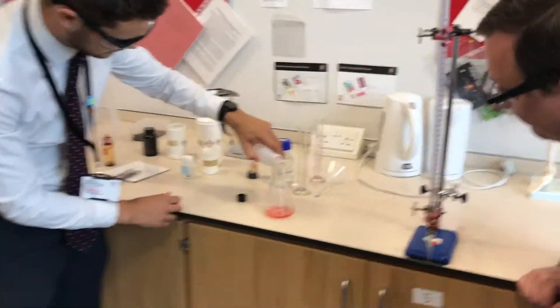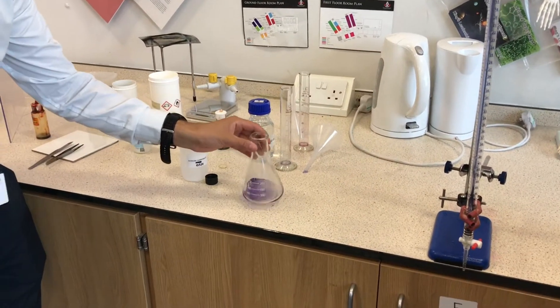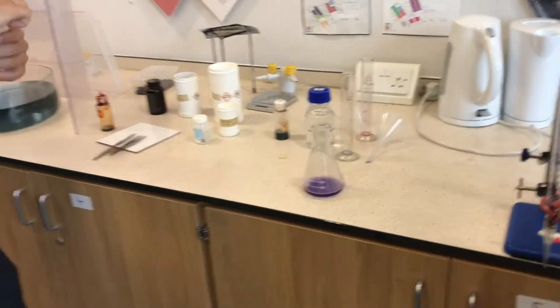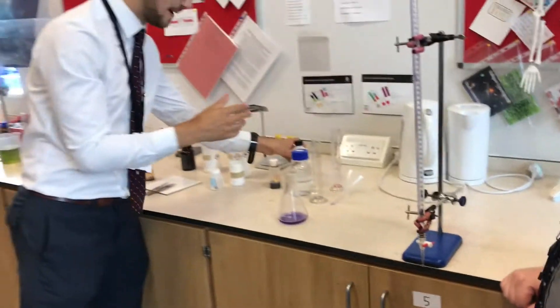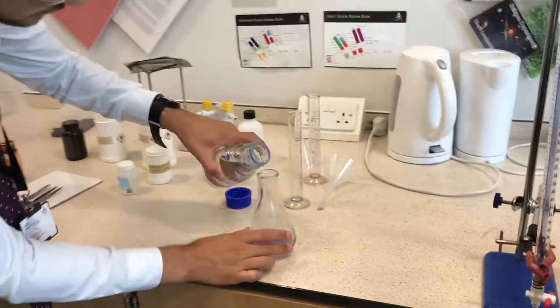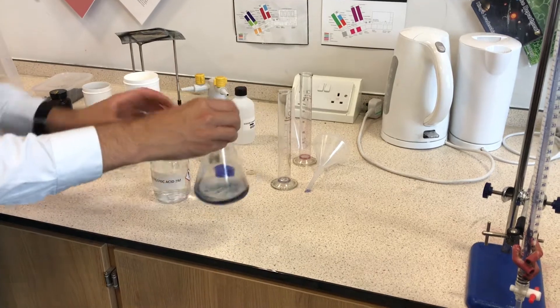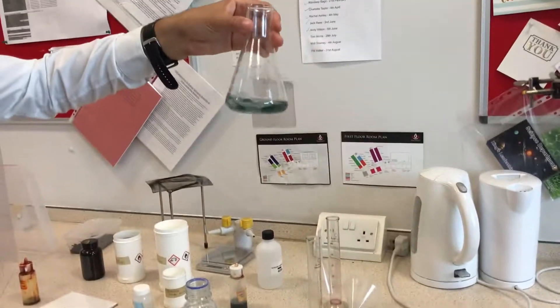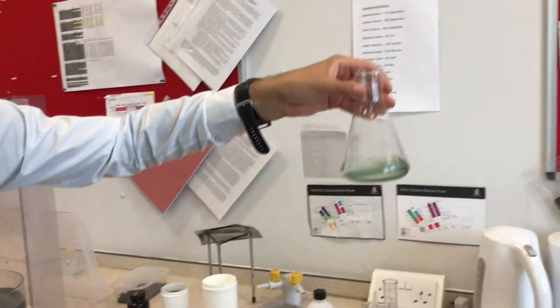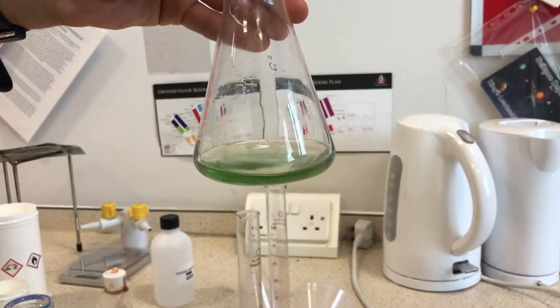Just adding this in the top — and it suddenly goes blue! As it starts to react again... oh, it's gone too blue. So we've got an alkaline solution. Let's go back the other way — I'm going to add slightly less acid this time so we don't react as quickly. Get some acid in. So that's a bit of red — that's better. Still a light blue there. Is that going green? That's going slightly green. We've got it! You've hit it by chance. I think I have. Perfect.